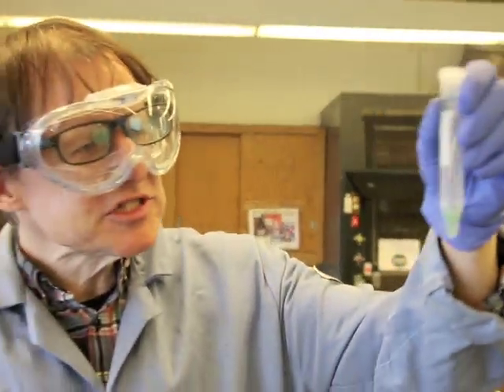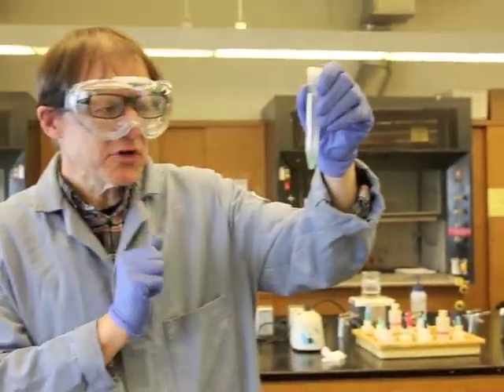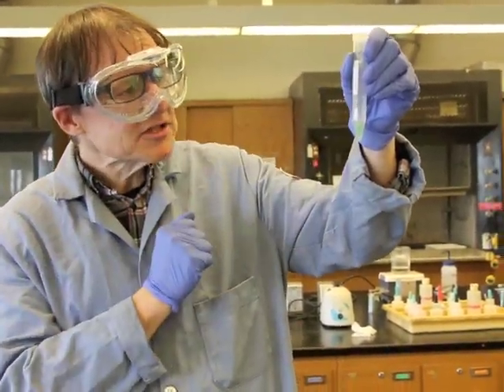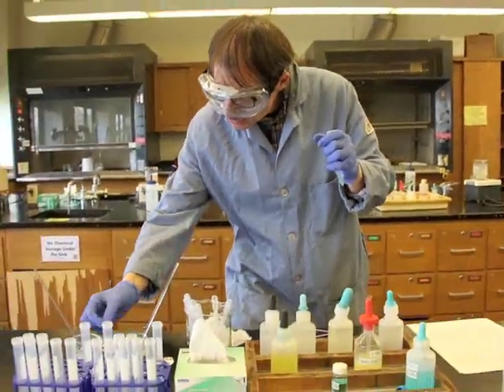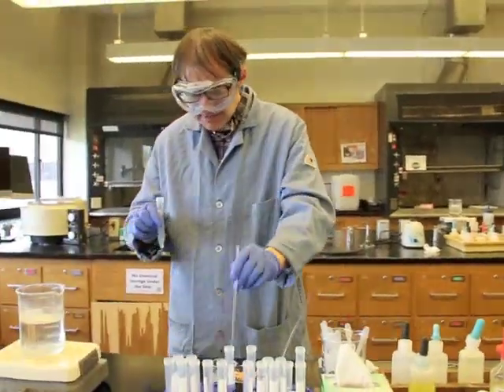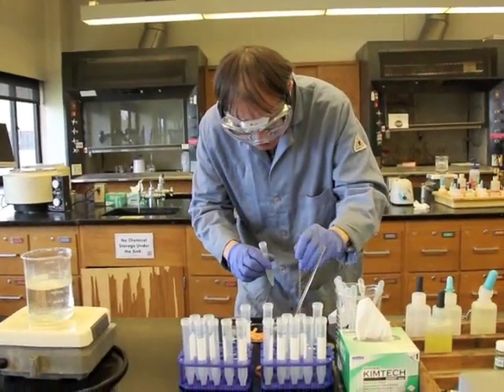Now, there's two reasons that might be. One is maybe I didn't drop exactly the same amount of sodium hydroxide, so it could be it's off a little bit. Or it could be that it has a different composition. Maybe some of those ions that were in the known are not in here. So here's what I'm going to do. To resolve the issue of whether maybe I didn't add enough of the sodium hydroxide, I'm going to stir it, and then I'm going to test the acidity on this paper.